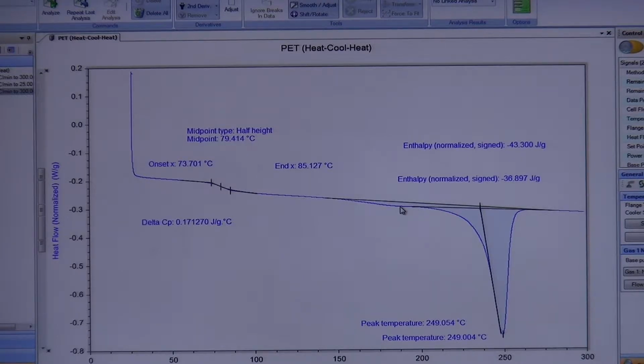And what happens if you look at certain equations in thermodynamics, you would see that as your crystals get smaller, the melting transition also gets smaller. So the temperature at which you melt the crystals is lower for smaller crystals. So essentially this sliver here that we first left out are those smaller crystals that were formed as it was crystallizing, and now it has to be included as part of your full melting curve. So I did this just to show you that things like this can definitely happen, and you want to sort of ask yourself those types of questions to make sure that you're doing the correct analysis and not leaving anything out. Okay?